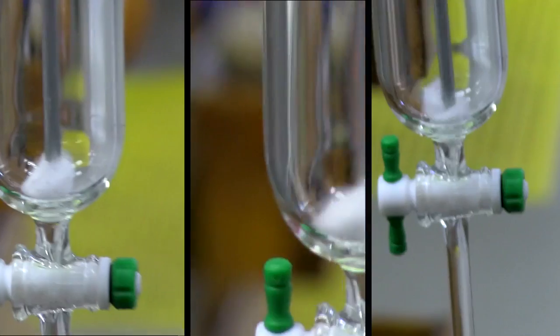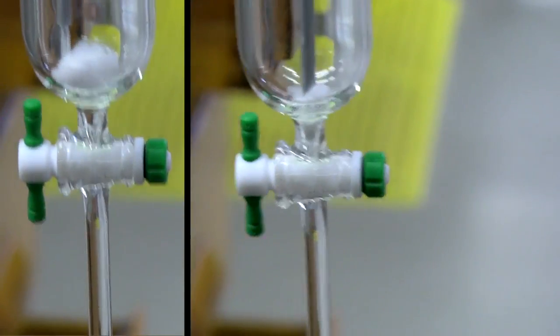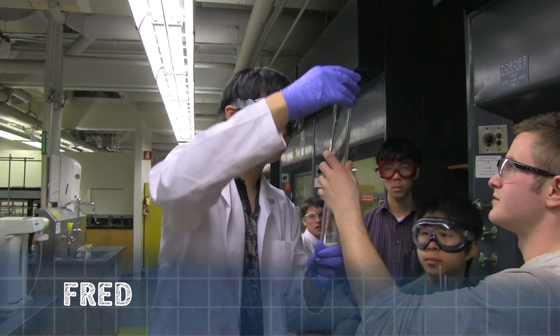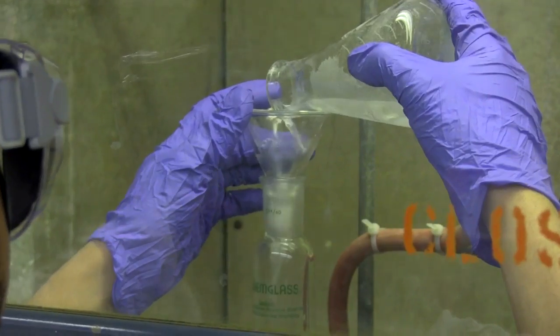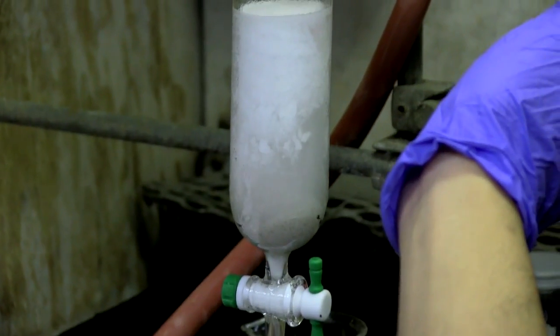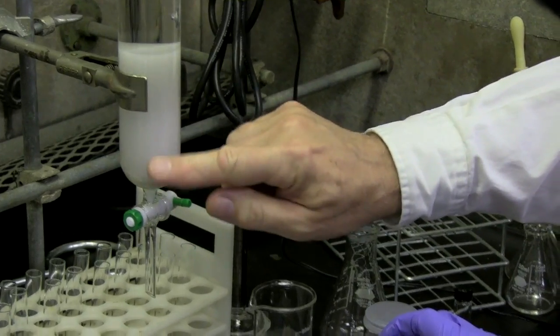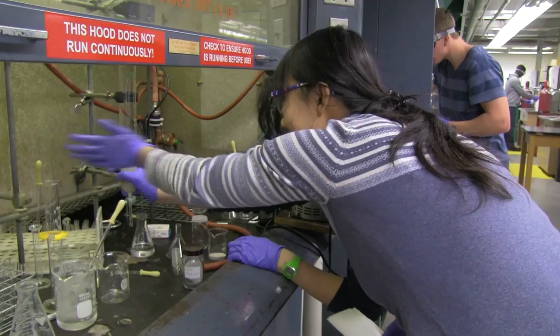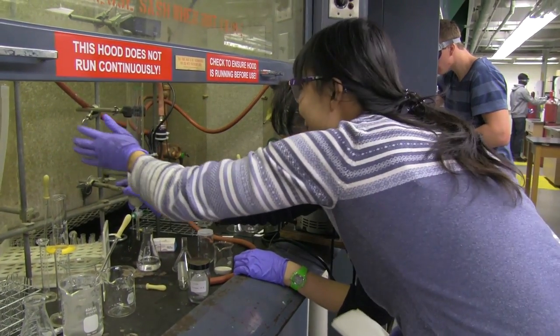As the TAs thought, everyone is stumbling over the first simple step. And the problems just keep coming. The sand static-ed itself all the way up my column, blew out the top and into my face. The sand is on the wall. She'll turn off the air, but it keeps going down. So the air's not on? Yeah. It's not good. There's bubbles in there, and you're in trouble.